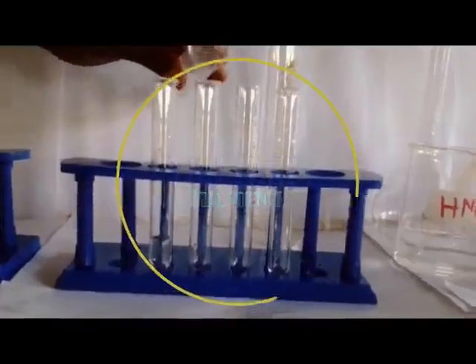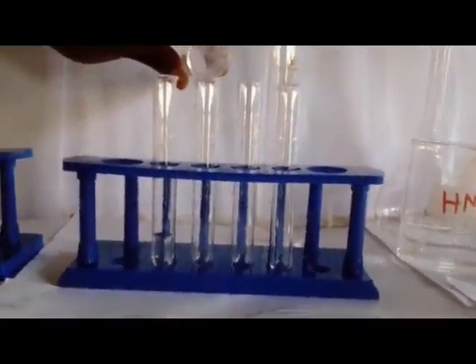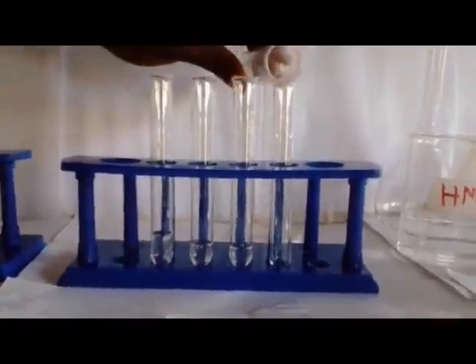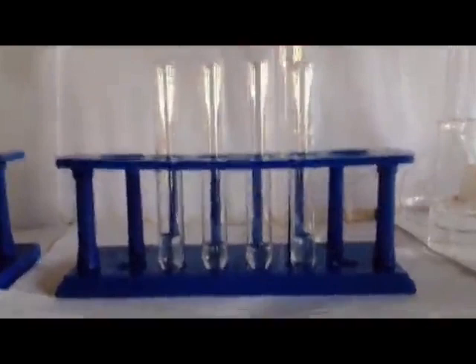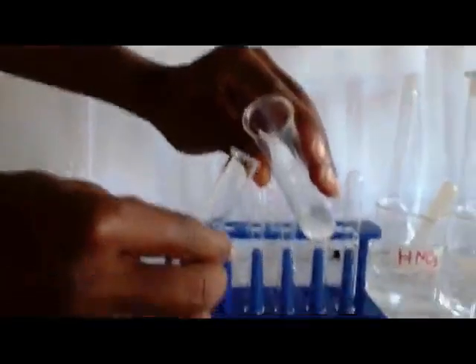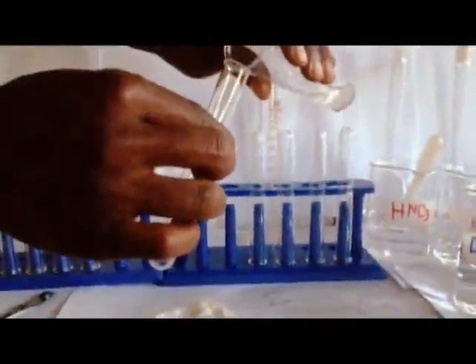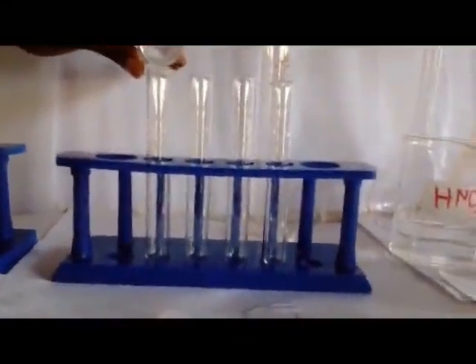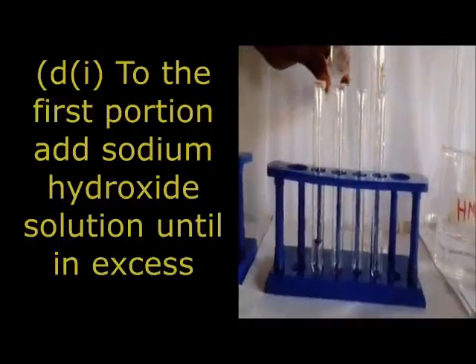Now after dividing, our second part of the question, remember our first part of the question was saying appearance. That was our first part, don't forget. Then our second part of the question was heating, don't forget that, members. Then our third part, they are telling us to dissolve in water, and the water which they told us to dissolve in was 10 cubic centimeters. Then we have dissolved, and then we are told to divide into 4 portions, which we have already divided.